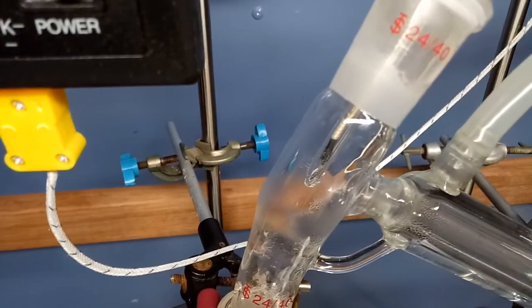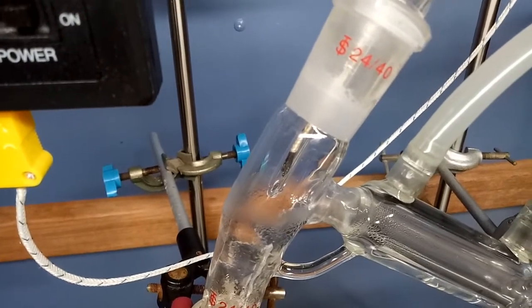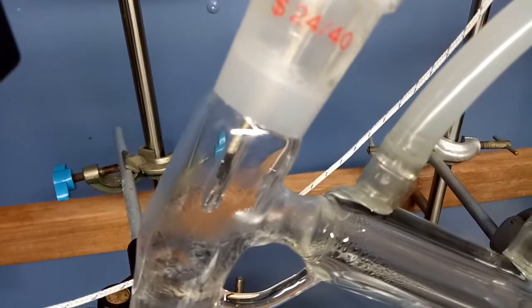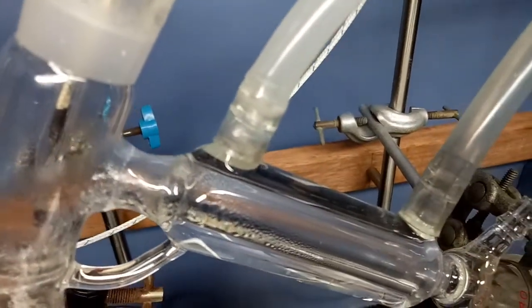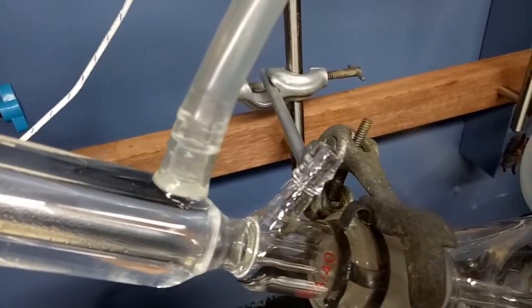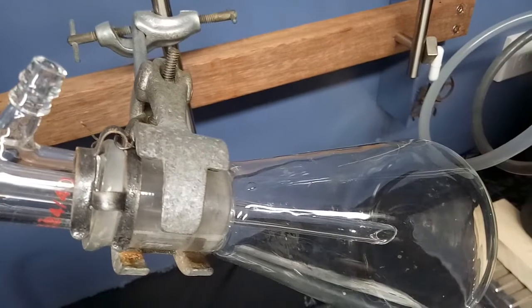This shot is me trying to catch the vapor front, the initial condensation, and the first drips, using a handheld camera. I always find distillation a really fascinating process, seeing the boiling liquid, seeing the condensation and refluxing down the side, seeing the vapor front, seeing the condensing.